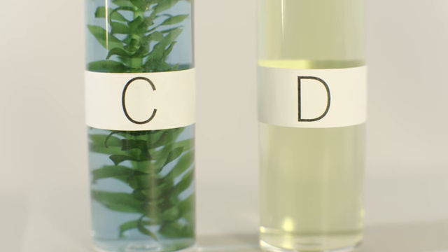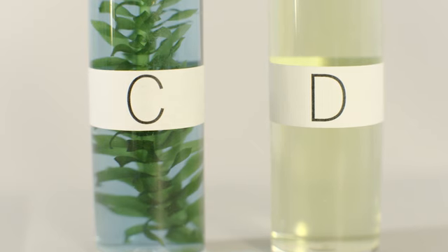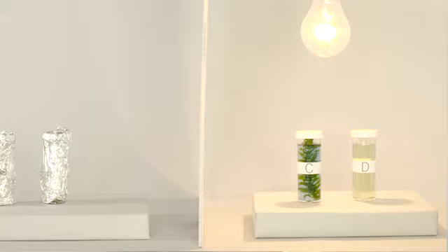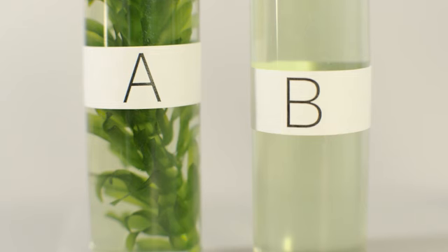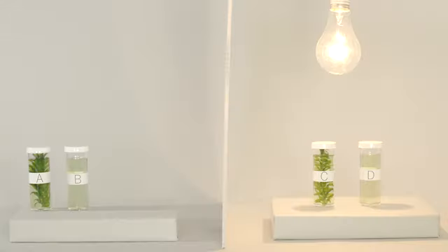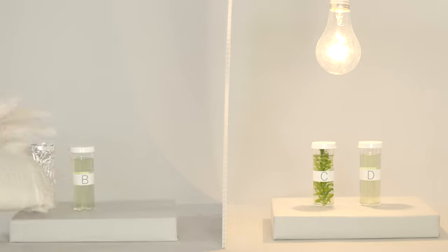The blue color indicates that no carbon dioxide is left in the vial. That's because the plant in vial C used all the carbon dioxide molecules for photosynthesis. The plant in vial C was under a light source. Even though there is a plant in vial A, the color stayed yellow, indicating that the level of carbon dioxide remained high. That's because the plant did not perform photosynthesis. The plant in vial A was covered with foil, so no light could get inside. Without sunlight, the plant could not perform photosynthesis.